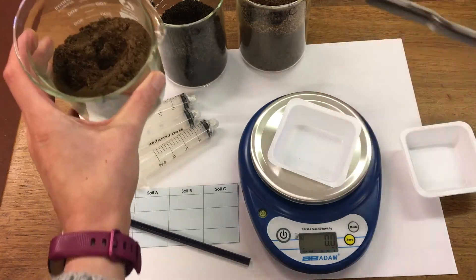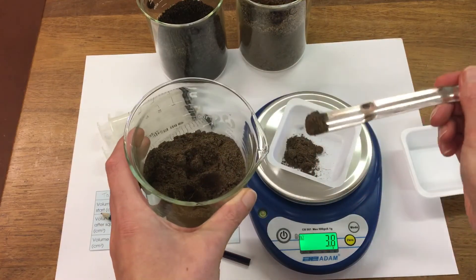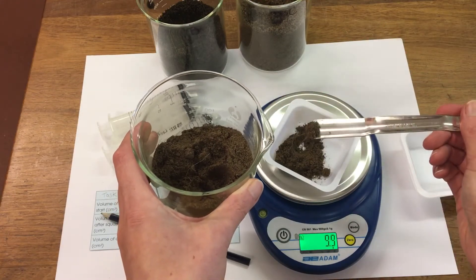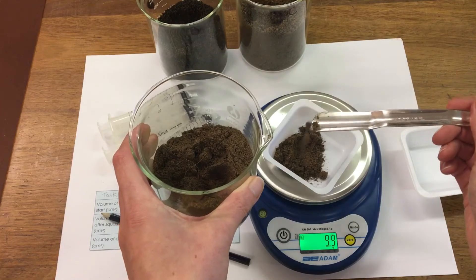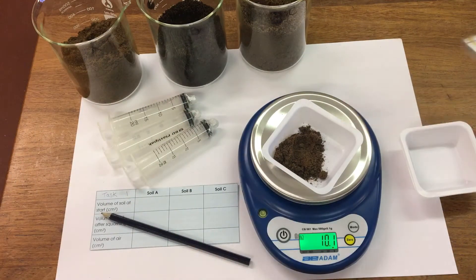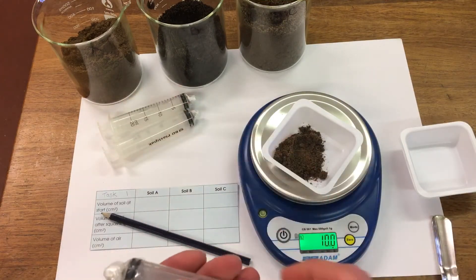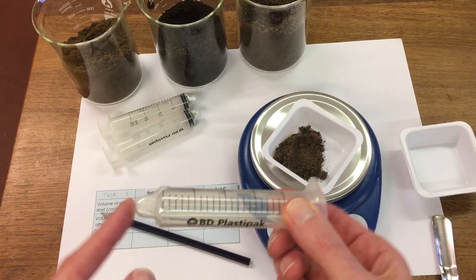So our first soil type A, we will measure 10 grams and then transfer our 10 grams into our syringe. The syringe is capped at this end to prevent the soil running straight out.